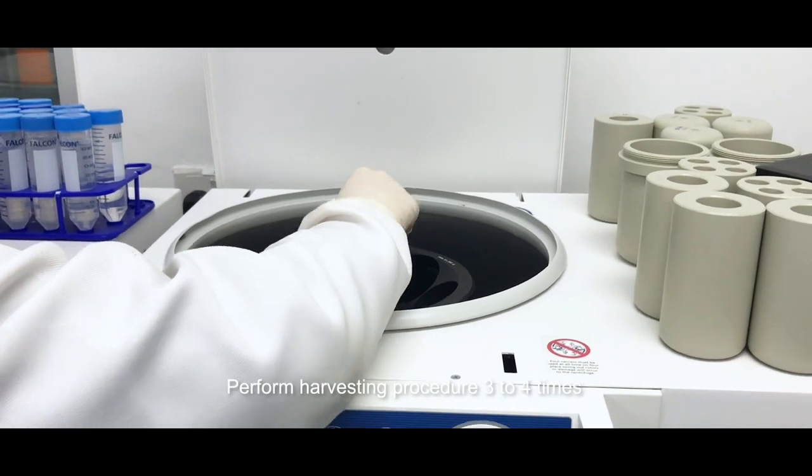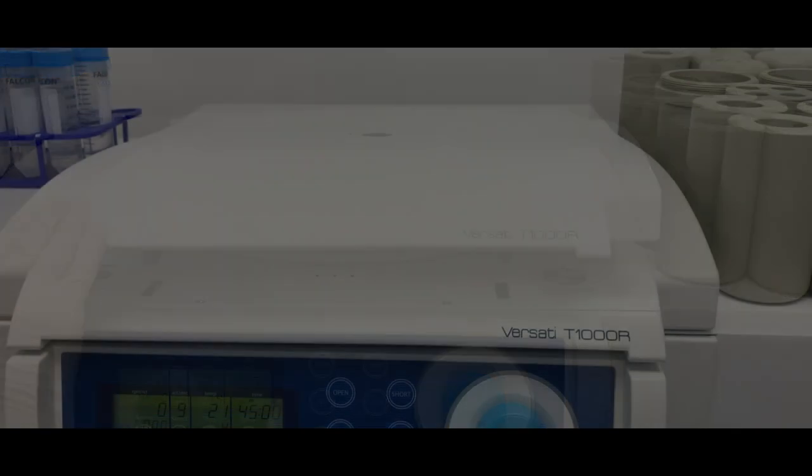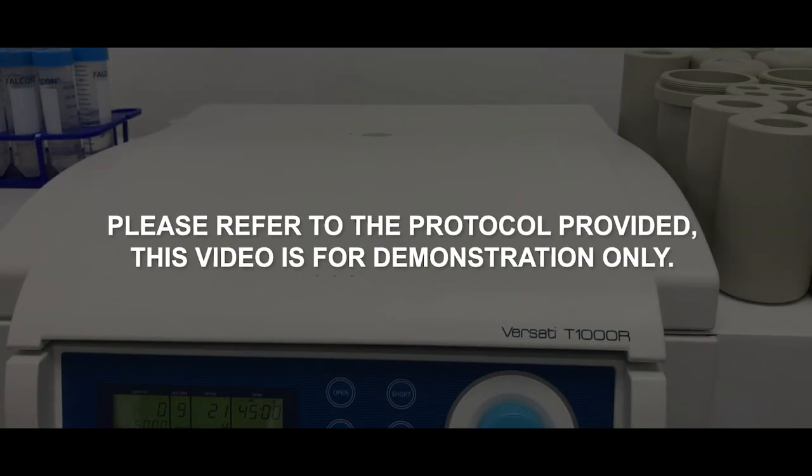The harvesting procedure should be done three to four times. Please refer to the protocol provided. This video is for demonstration only.